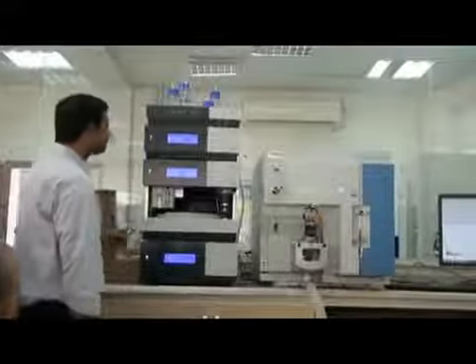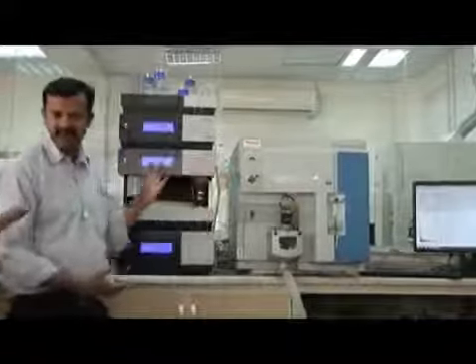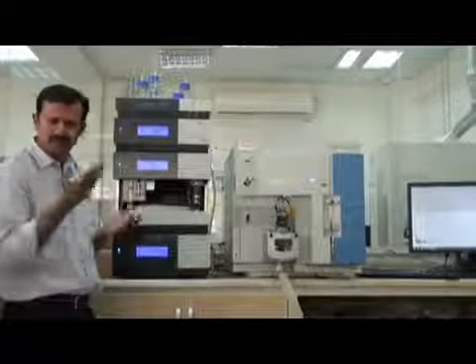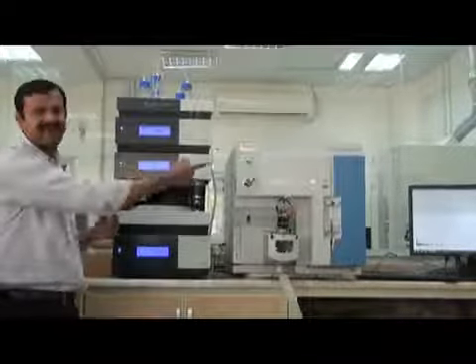Okay. Now come to this part. Here we have the MS. Can you see it? I will come back to it when I am working here. Any questions? Ask me, no problem. I will forget the purging, how to make purging. When I come here, I will do the purging and then explain.